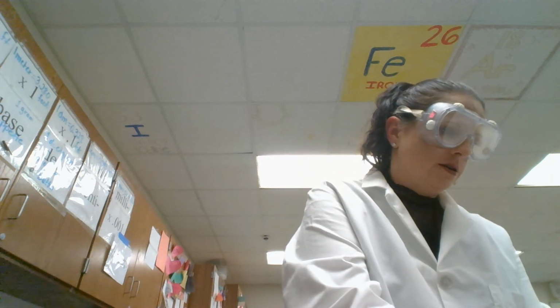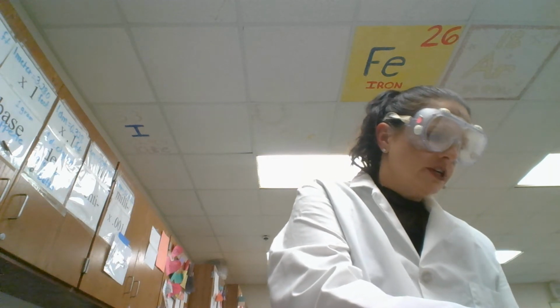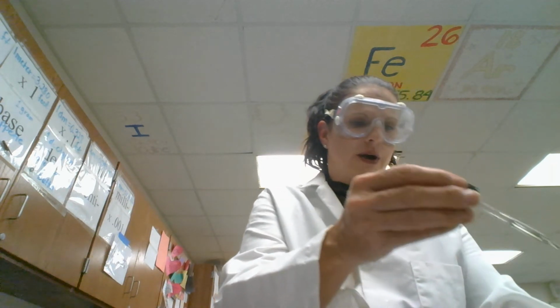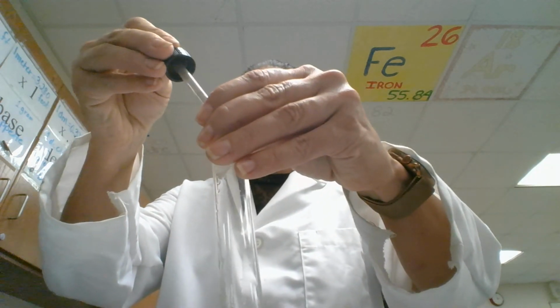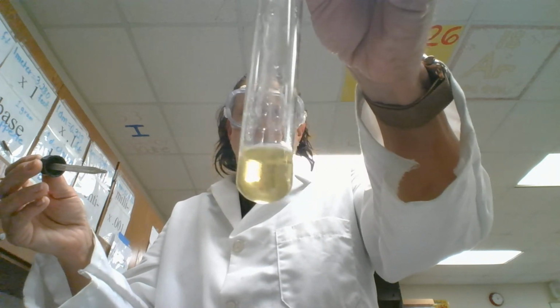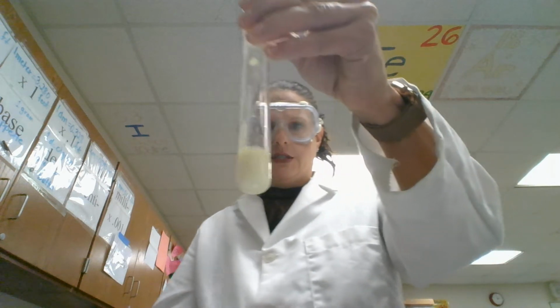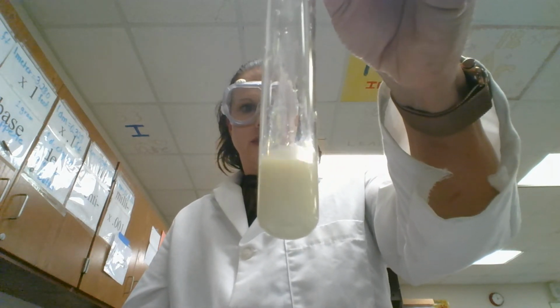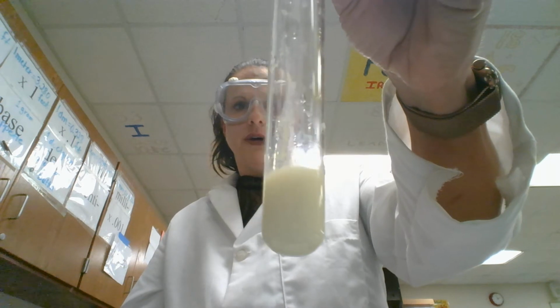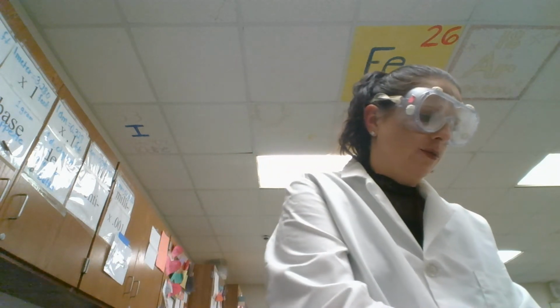And then finally, for the first part of our observations, I'm going to add the silver nitrate to the sodium iodide. And it's a little bit cloudy at first, and it cleared up. I'm going to add just a little bit more just to see. There we go. Now it's nice and cloudy. And I don't know if you can tell by looking on your computer, but it's a little bit more yellow, again, from that iodine that's dissolved in there. All right, so that's the first table, or the first half of the table.